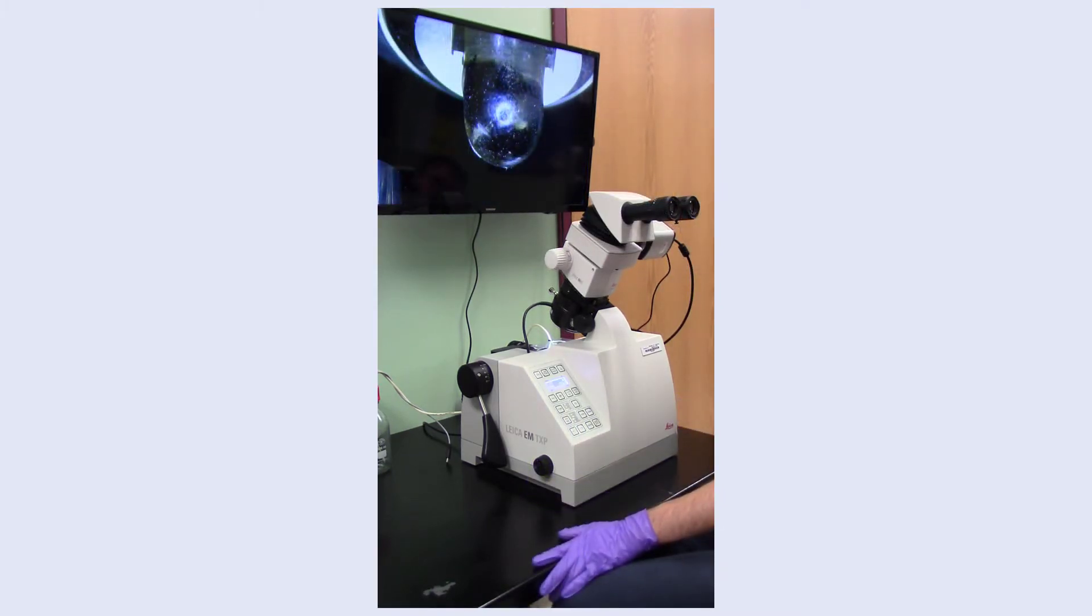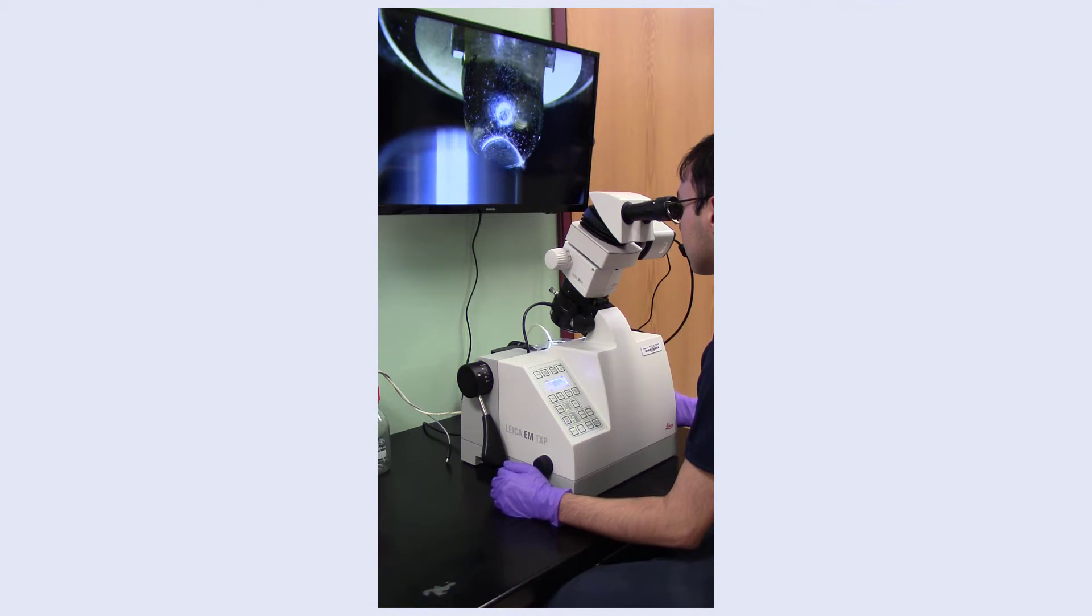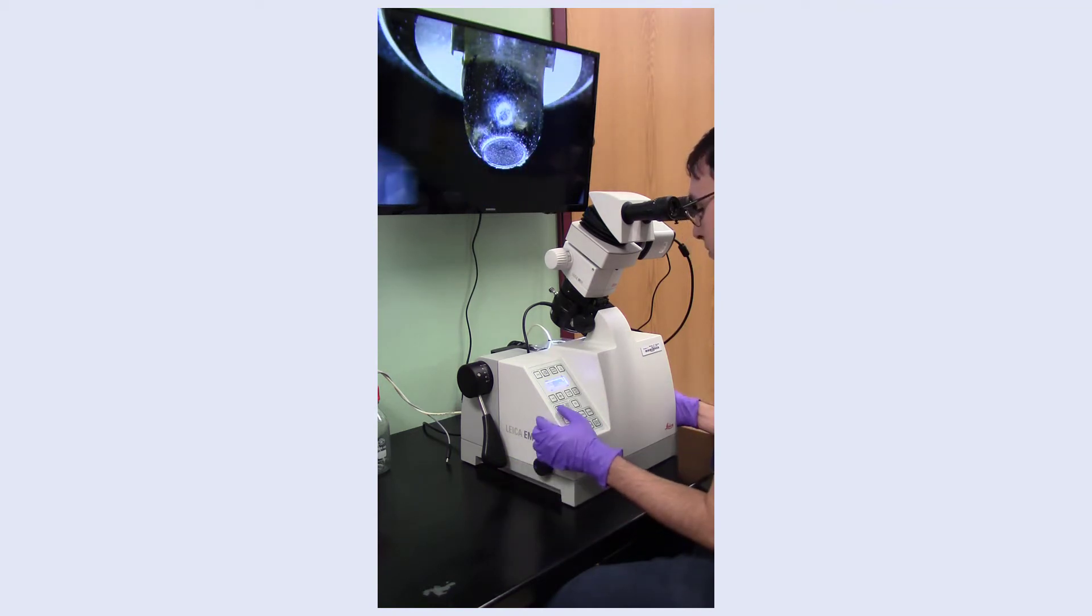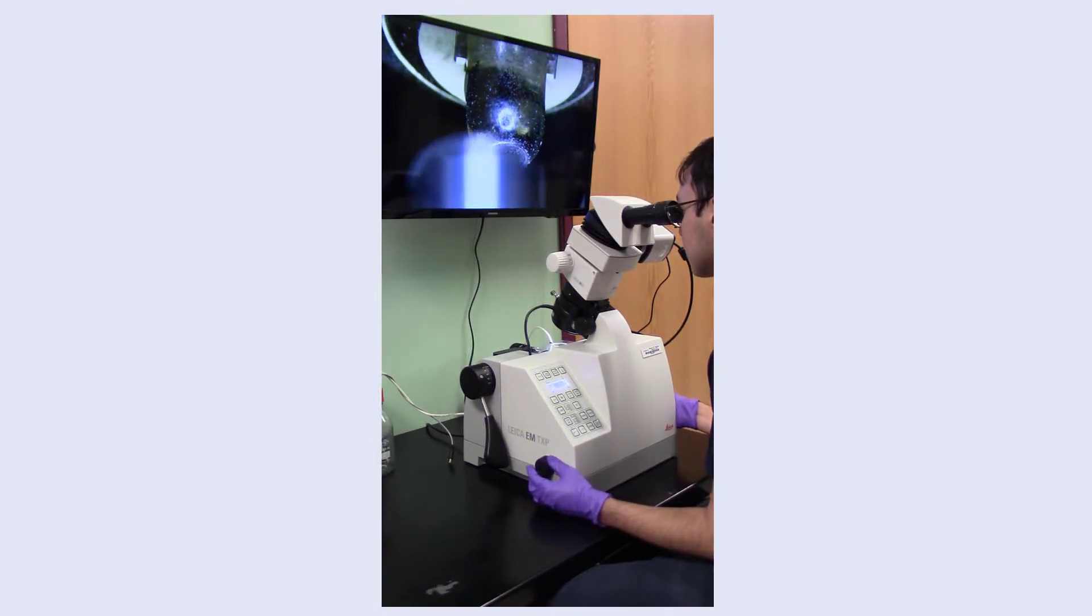When contact is made, bring the control lever to the left of your sample and turn the vacuum system and the spindle motor on. Begin making a full pass at your sample, then advancing using the feed wheel. For the best surface quality, make slow passes and change the step size to 1 or 0.5 micrometers when advancing. Continue until your desired sample height is reached, then turn off the vacuum and spindle motor.